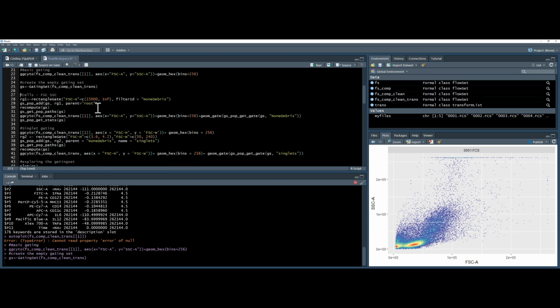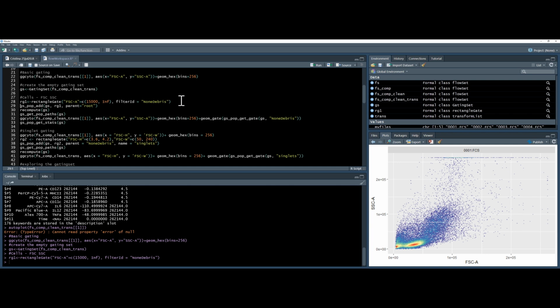Then I want to produce a rectangle. So I'm going to make a rectangle gate on my forward scatter parameter. I want to call it non-debris. Basically, this is going to create a rectangle from the 15,000th channel to infinity in forward scatter. That should be around here, all the way to the very edge of the plot. And then I'm going to use this gs_pop_add command to apply this to my gating set.